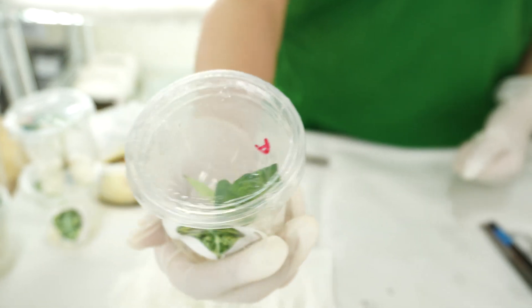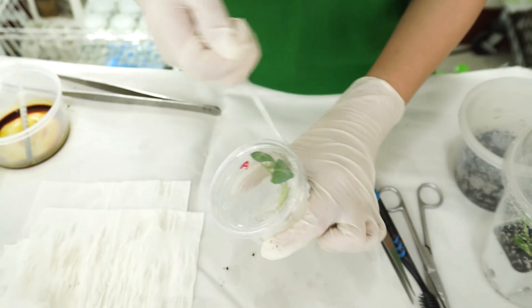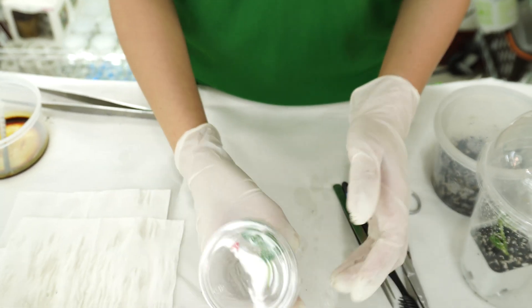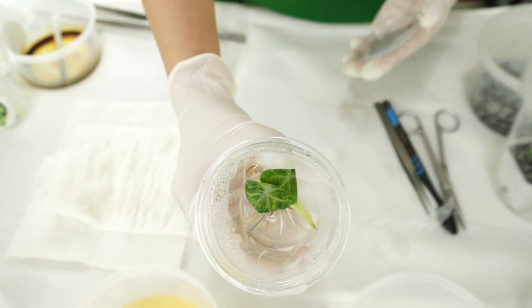Here's another one we'd like to show you. This plant comes from a plastic container — not a plastic bag, but a hard plastic container or plastic-top container like this.